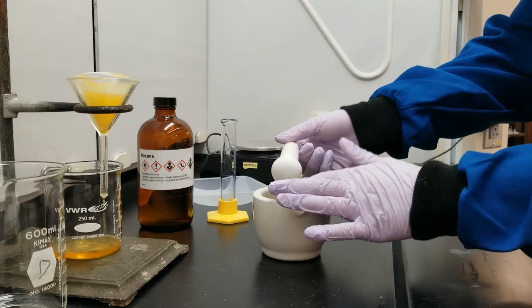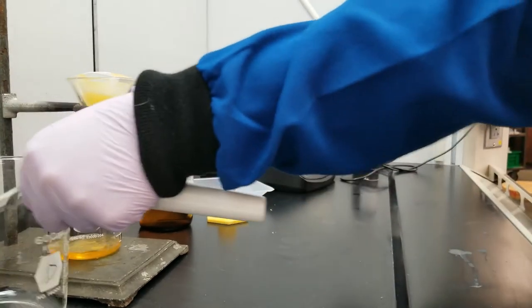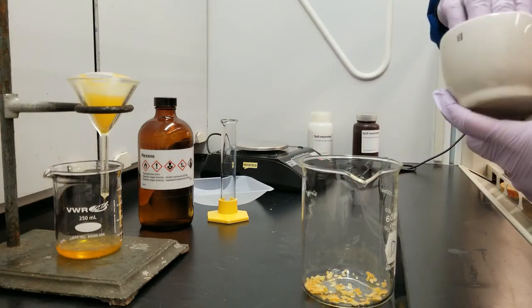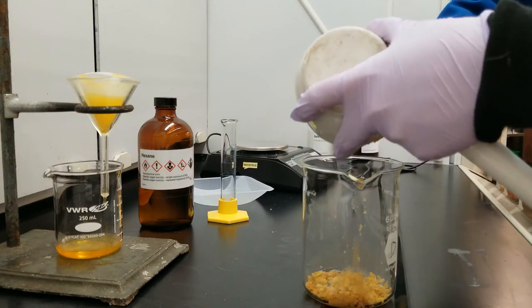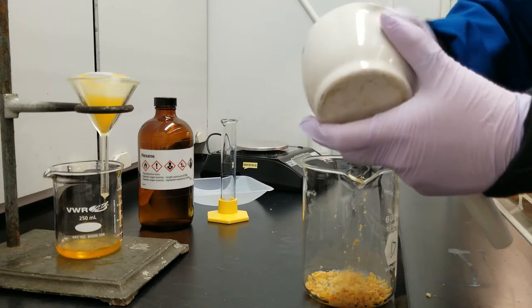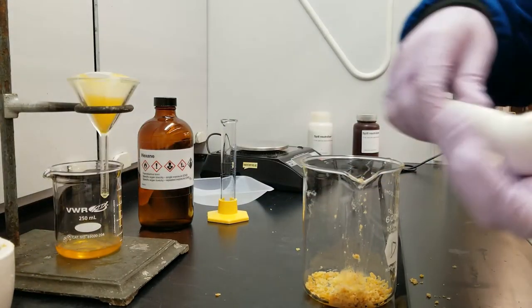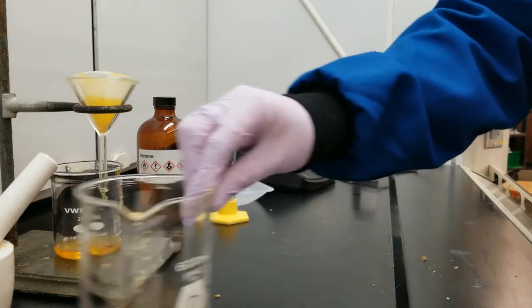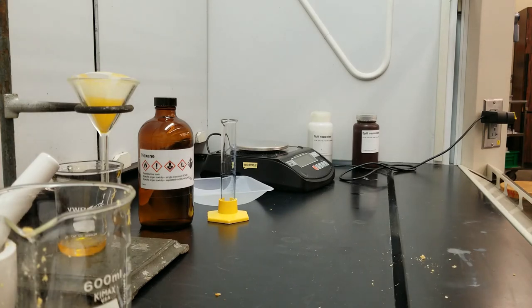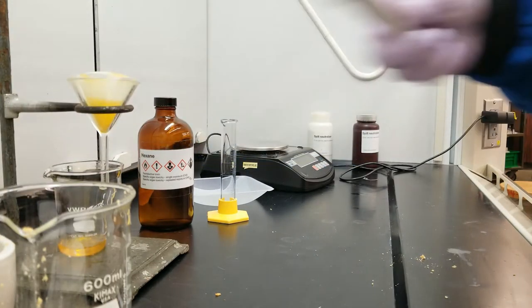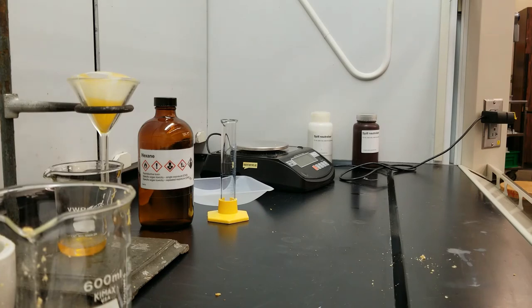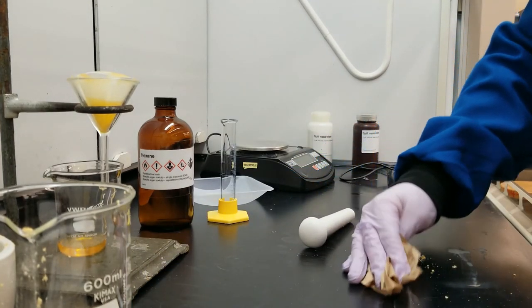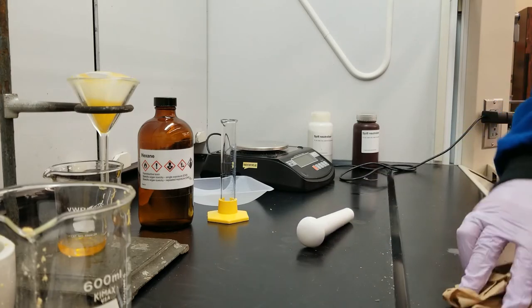Now that I'm done with my potato chips, I can put them in my waste beaker and I can clean up that mortar and pestle. I'm going to use a paper towel to clean up my mortar and pestle while I'm waiting for that to filter. I'm going to try and collect all of my extra potato chips from the hood.